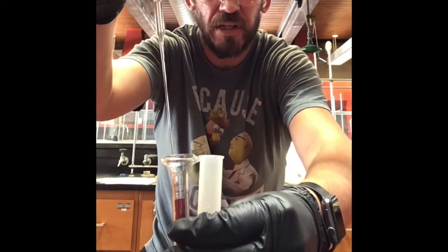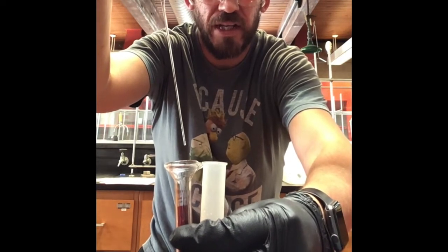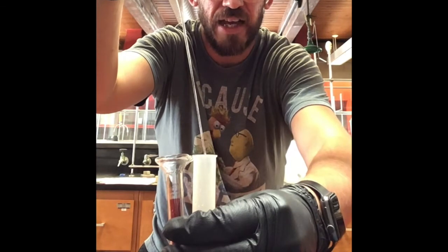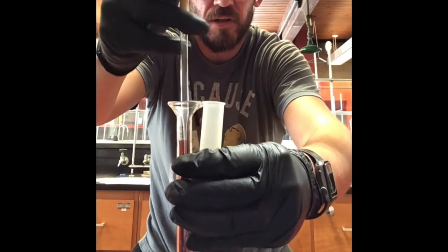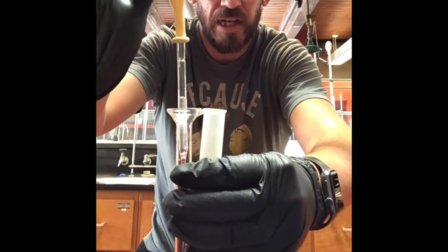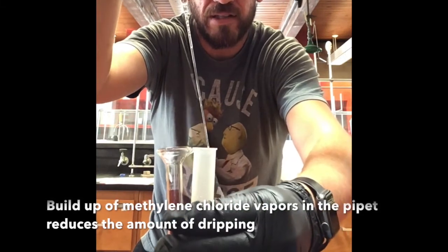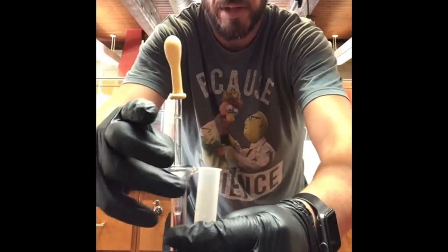And so that's what I'm going to do. I'm going to just lift this up. It's dripping at somewhat of a constant rate. And so once it drips, I move. And then I squeeze the pipette bulb to squirt that inside of the centrifuge tube. Okay? And then I can do it again. So squeeze, let go. See it kind of going up. And you can see it's actually not squirting down yet. And so now is the time to move. Okay? And there you go. Now I've transferred my 2 mils.